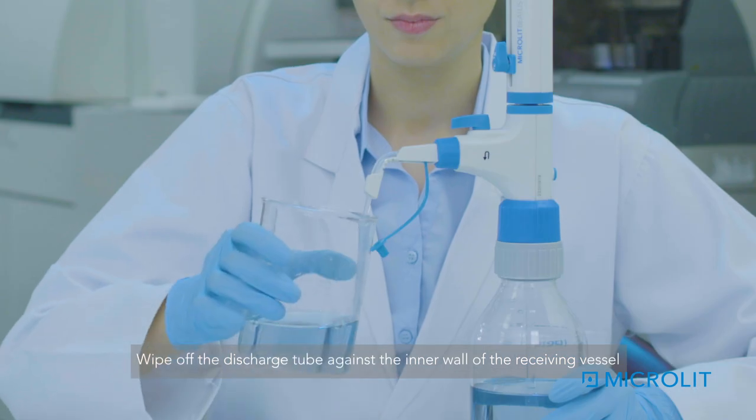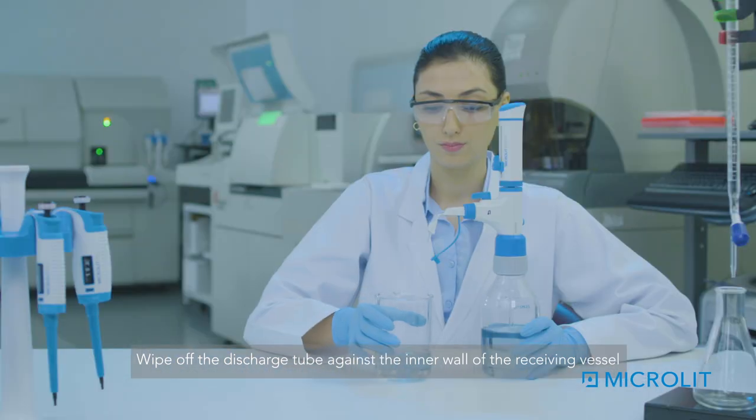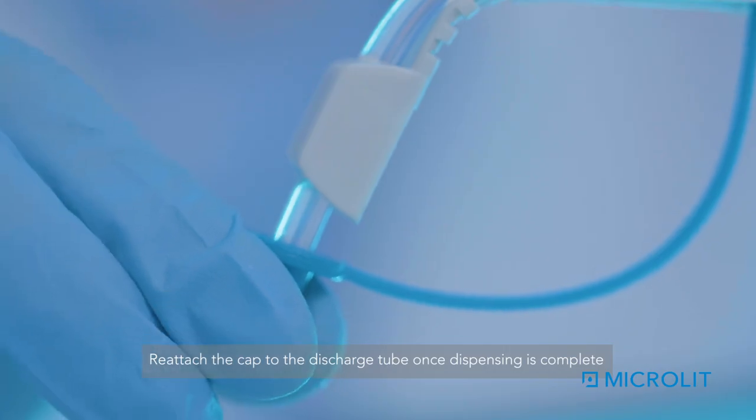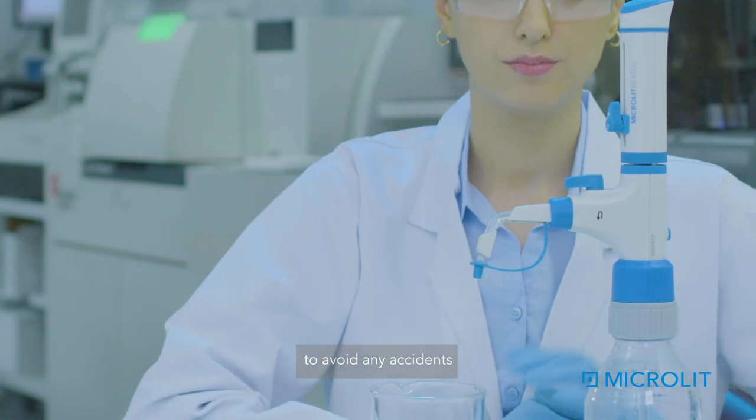Wipe off the discharge tube against the inner wall of the receiving vessel. Reattach the cap to the discharge tube once dispensing is complete to avoid any accidents.